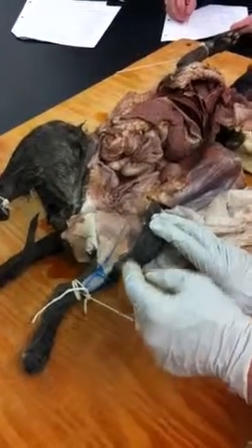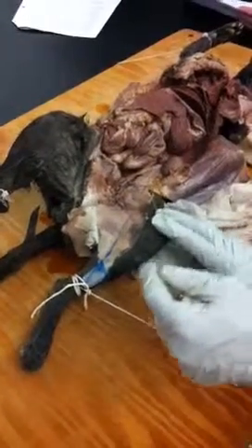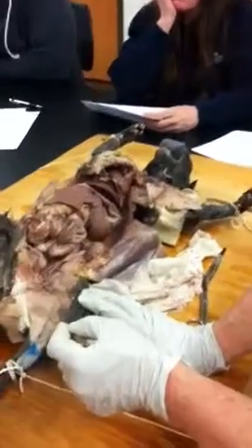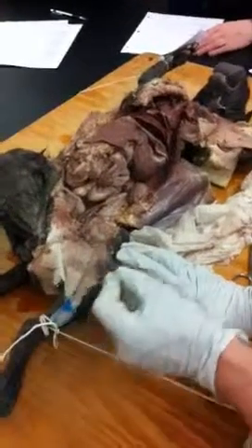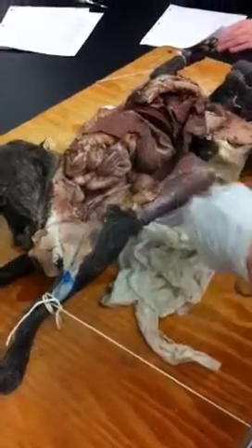This is one of the places where they do the injections. This one isn't totally ruptured. Sometimes they get totally blown out, so you can't find them. So this is pretty good shape. What injections do they do? The color. The latex. Like a medical treatment? No, in terms of preservation.